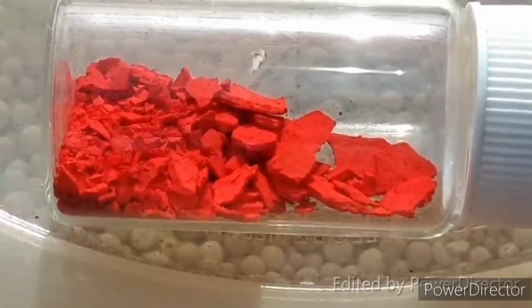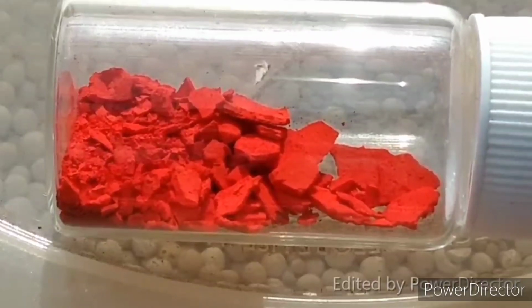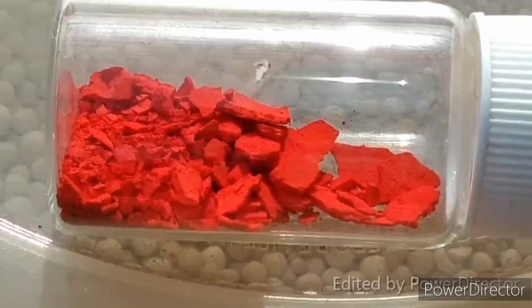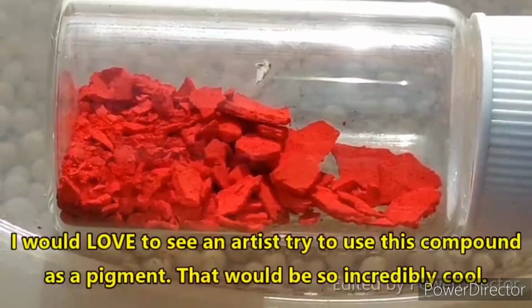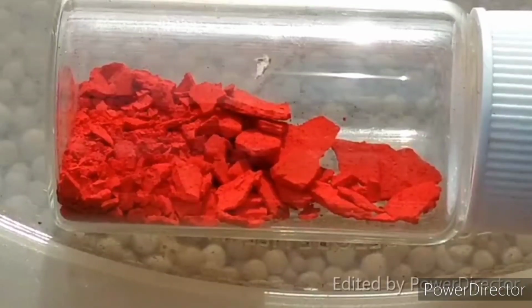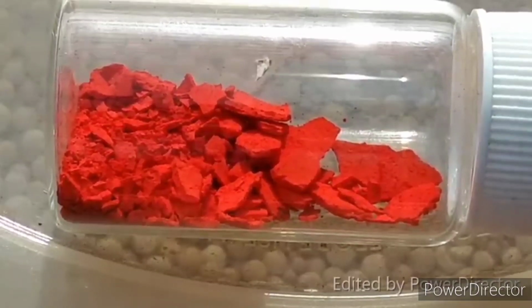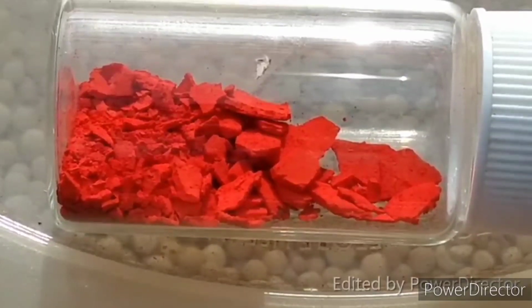Anywho, this is what we have got. Look at that. It is absolutely fucking beautiful. That is great. Doing it in a stoichiometric mix definitely gives you a better product. Honestly, the camera is pretty much capturing it exactly as it is. Maybe making it slightly more red, but not by much. So, there you go. Dicesium pentaiodobismuthate 3. That's some cool shit, right?